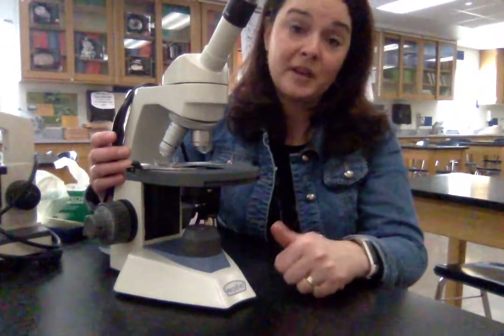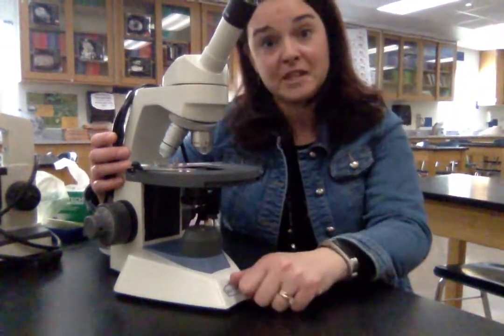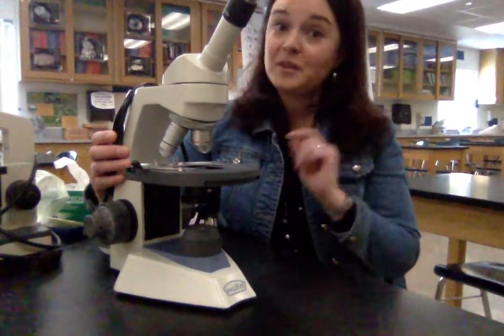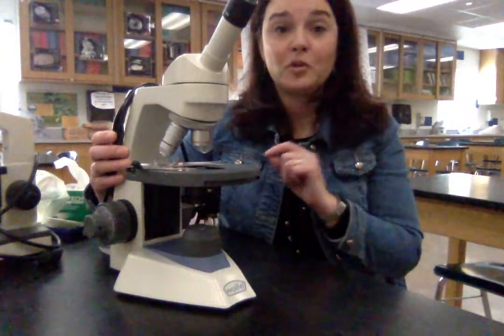Practice makes perfect. Use your diagrams to practice labeling. Learn all the parts, learn what the parts do, how to determine what magnification you're on, and use the online games and simulators. You can quiz each other — sit at a desk with a microscope and point at the parts, asking your partner what each part does or what it's called. Once you've successfully passed your microscope quiz with at least a 16 out of 20 — and you can take it as many times as you need — you'll be ready to move on to lesson two in the lab.